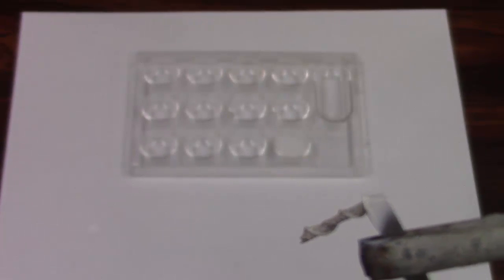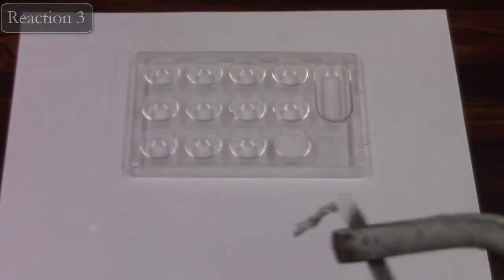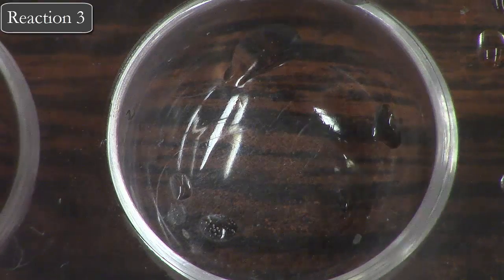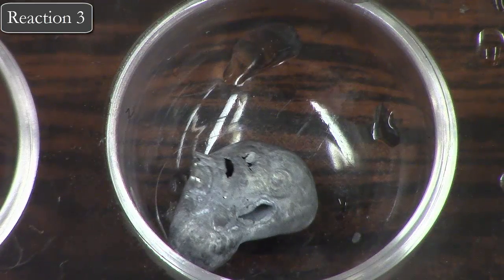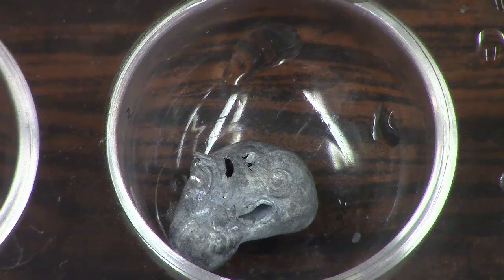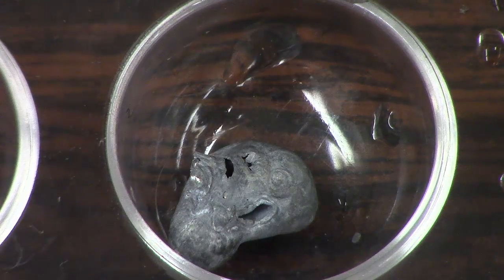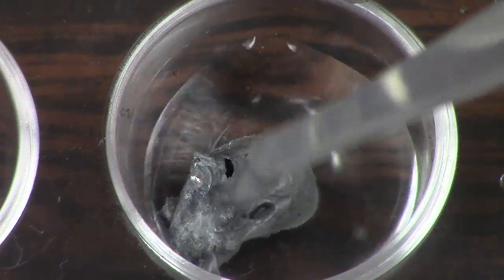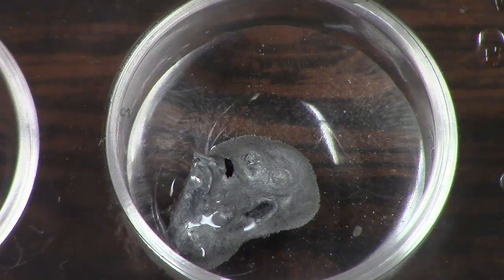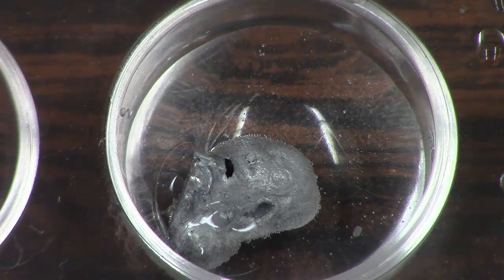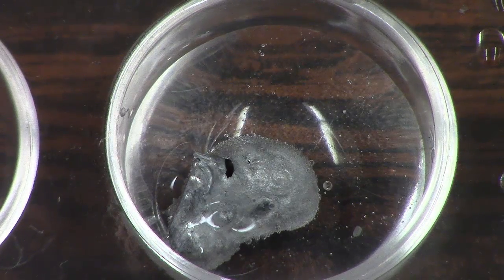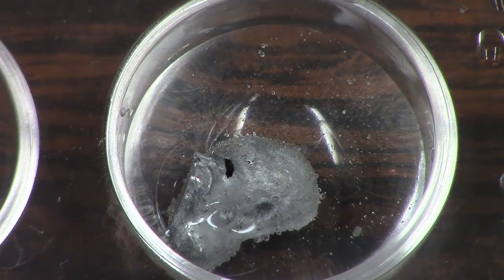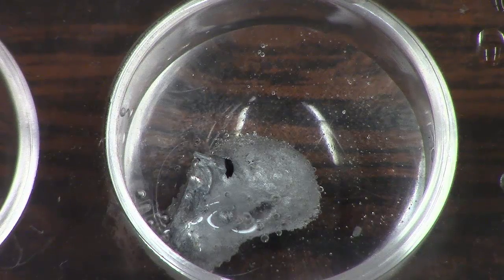Next, we're going to do zinc solid, which you can see right there, plus hydrochloric acid. Watch carefully—it's a slower reaction. I'll let you watch it for a bit, but try to predict the products. You can see bubbles are forming, so write down some observations.